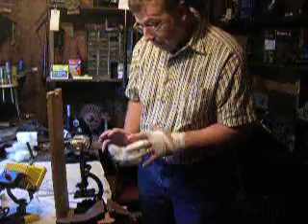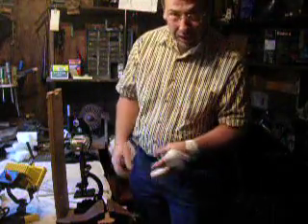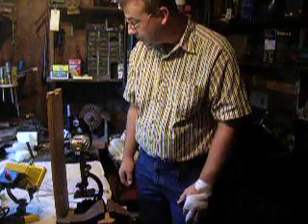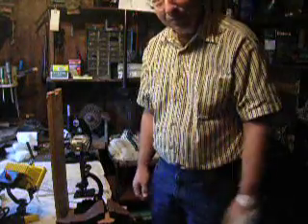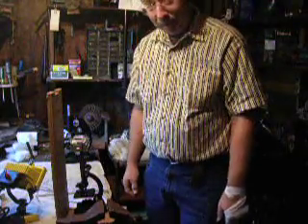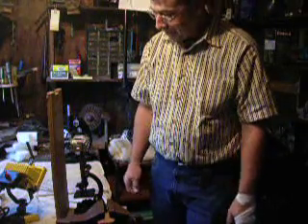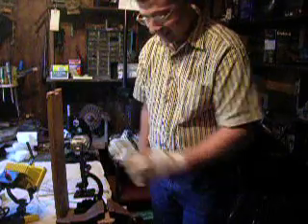So it's really not an expensive setup. If you have a digital camera, I mean, granted, the digital camera is a larger expense, but now they're dropping, and you could probably do this yourself. And post videos from looking at the microscopic world that help us to understand it better. All right.